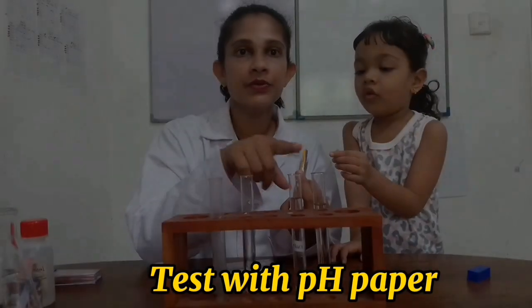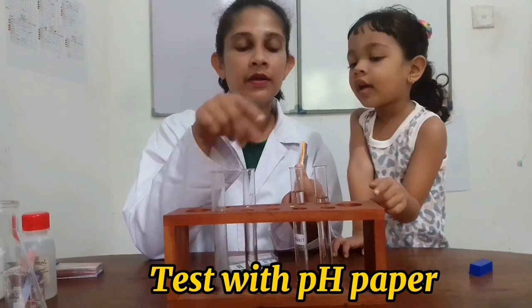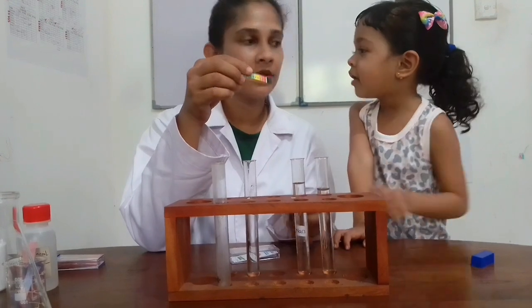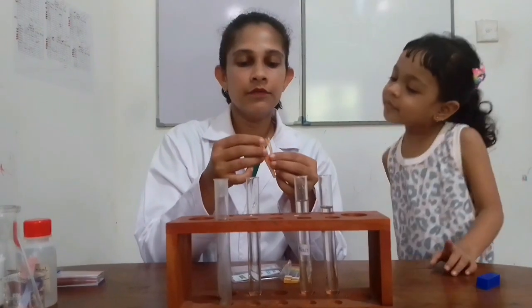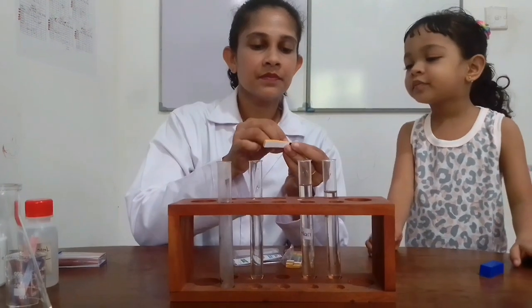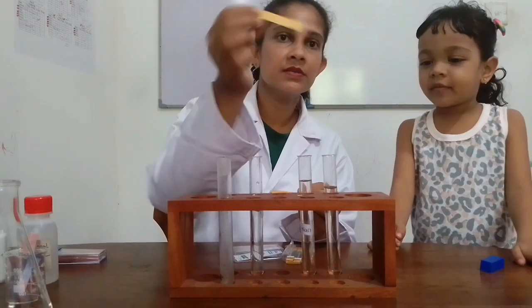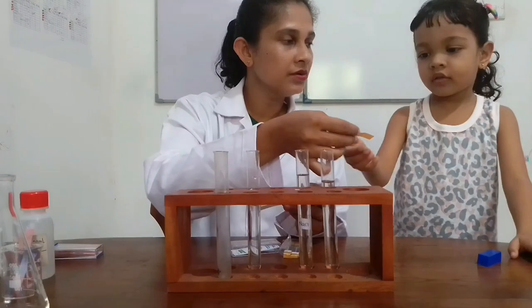Now I am going to try each solution, sodium hydroxide, sodium chloride and dilute sulfuric acid, with these pH papers. The color of the pH paper is yellow. What we have to do is dip the pH paper in the solution. If you want, you can try. Do you want to try?